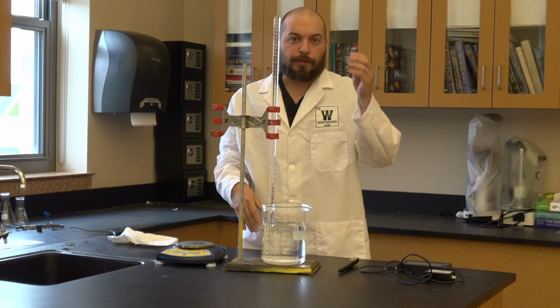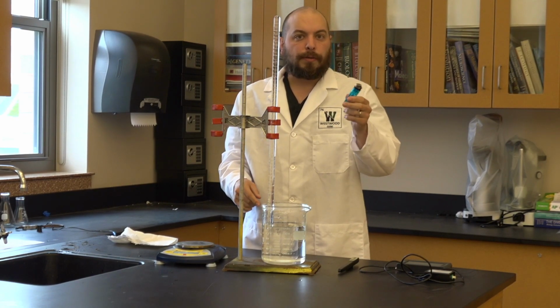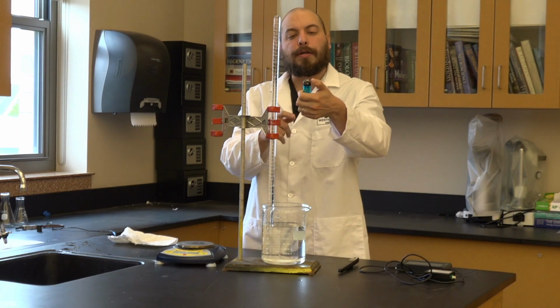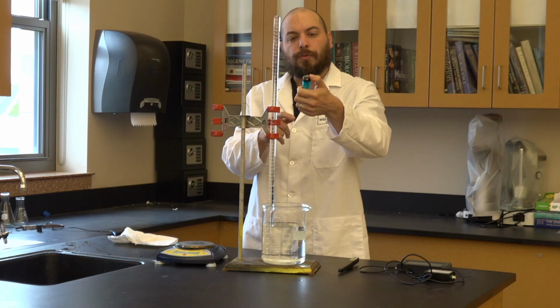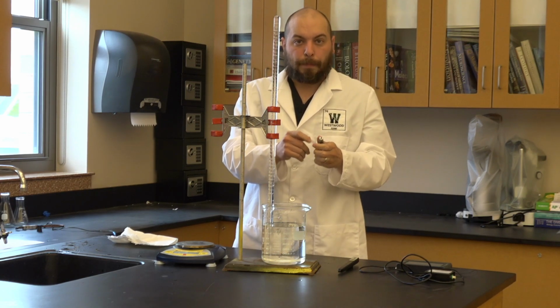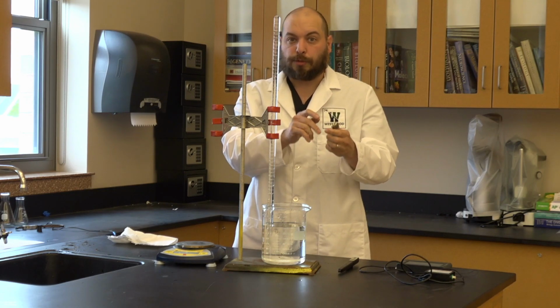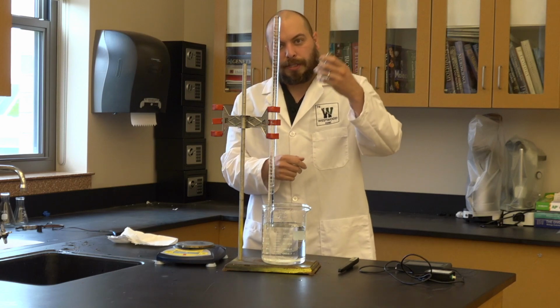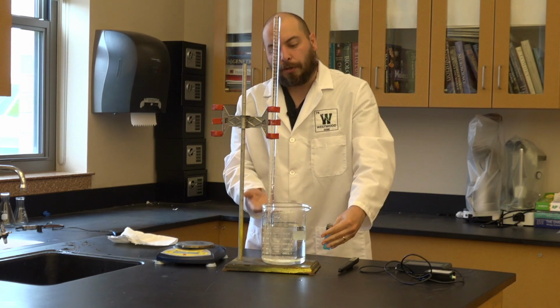Then, with my already measured lighter, I'm going to undo or open the top. This would be like if I was to strike it, but without striking. I don't want to burn anything. I just want to release the gas. You can do this very quickly. You're going to take it, submerge it underwater, and release the gas.